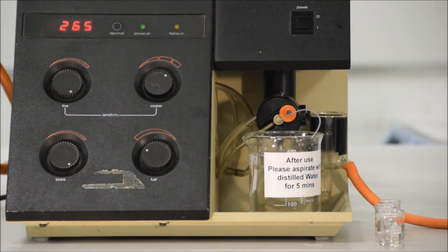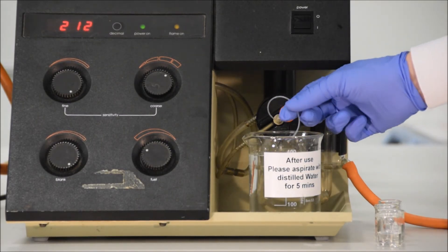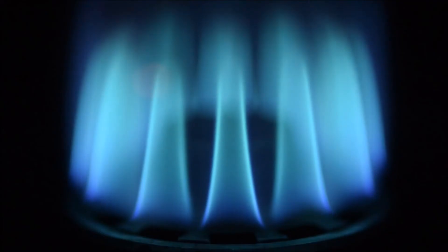So now we're all done. You can take your values, create your standard curve, and measure your unknowns. Before we go, let's have a look at one or two other things.